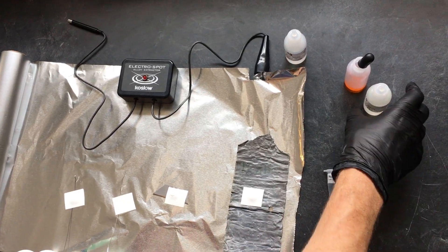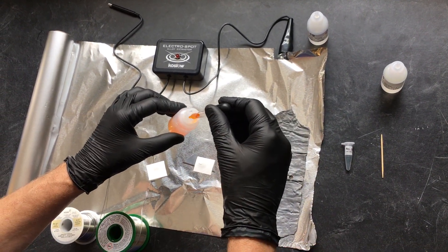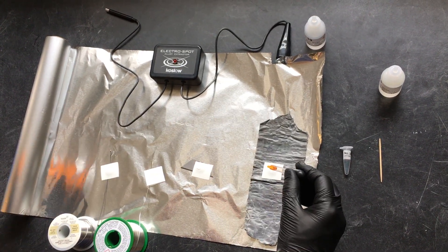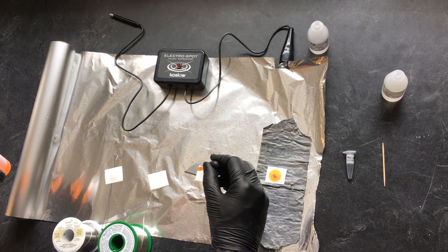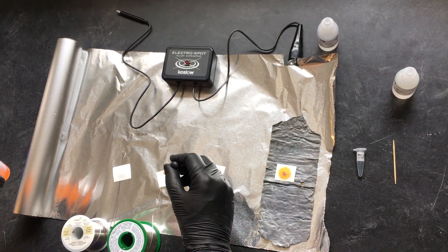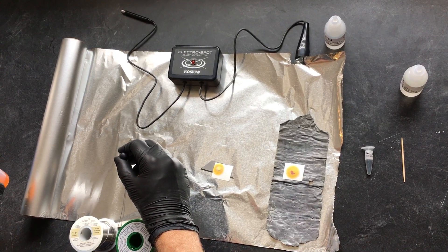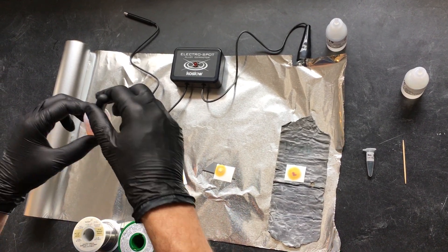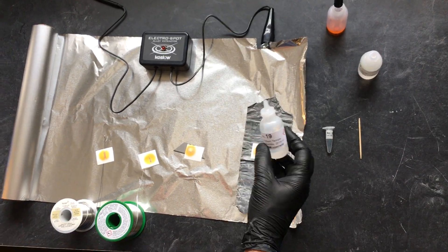And then add the orange solution, number 20. And then chase that with a drop of 19.